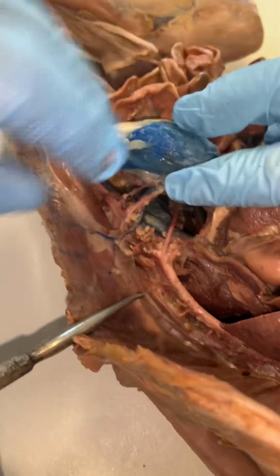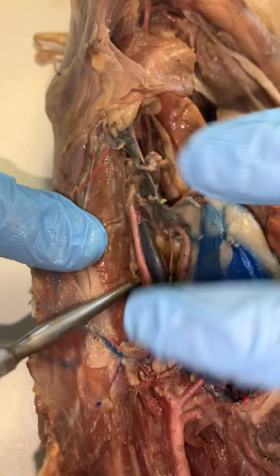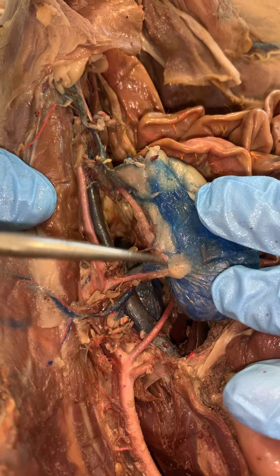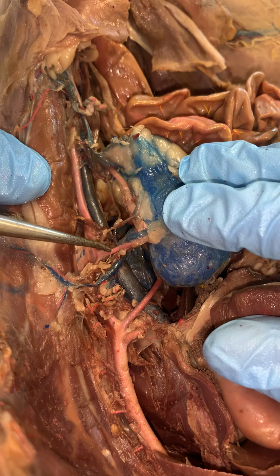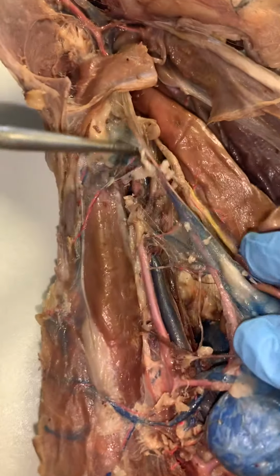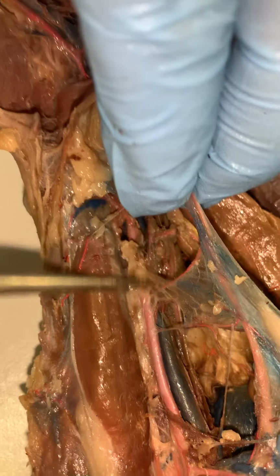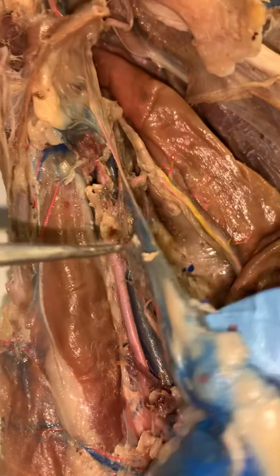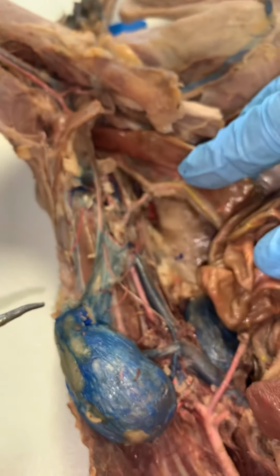If we continue on down, there's my abdominal aorta, right here. The next branch coming off, this will be paired, and this is the renal. In this view, this is going to the left kidney. On the opposite side, we've got one going to the right kidney. So this is our first paired structure here. If we continue on down, we've got another branch coming off down here. This would be our inferior mesenteric, and this will be going to the structures of the large intestine, the sigmoid colon, those types of things.